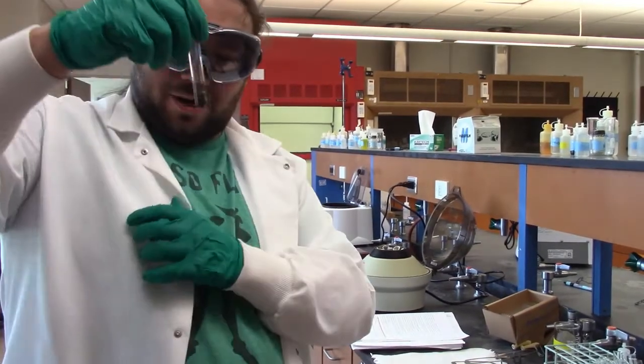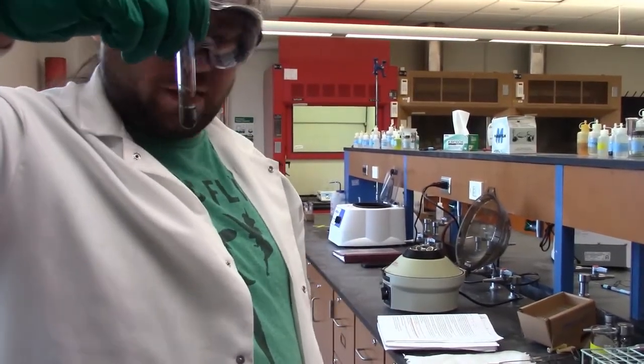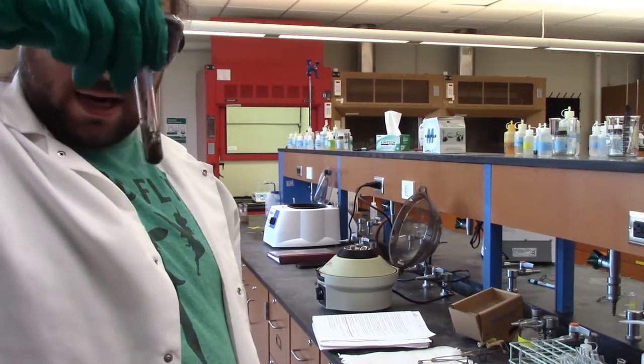All right. So we got our KOH, and like Professor French said, that should be dissolving our tin to make the complex ion. Give it a go.